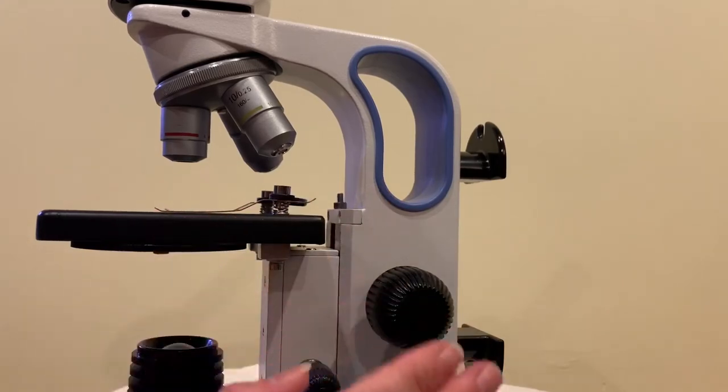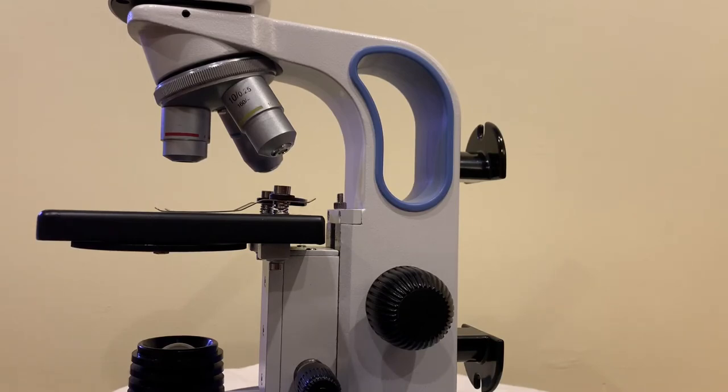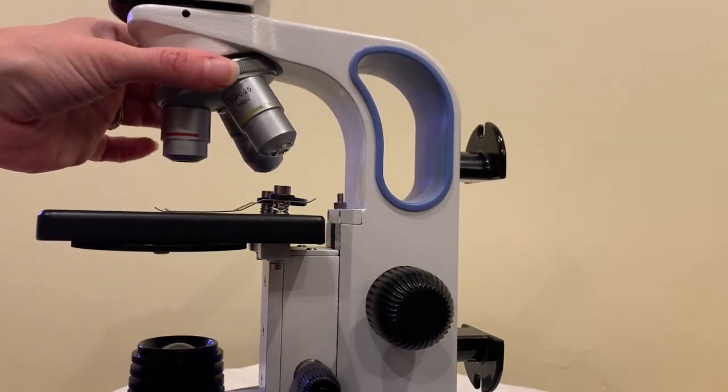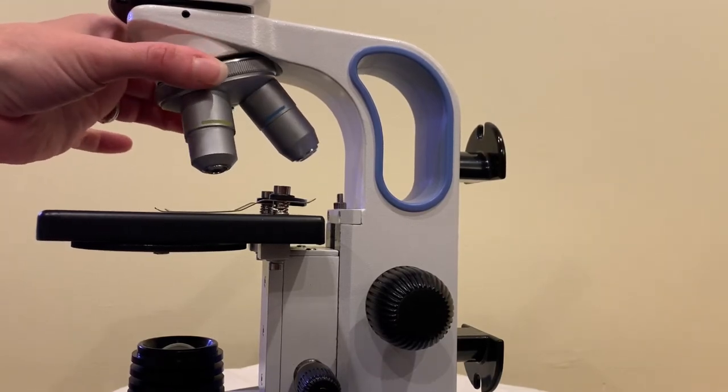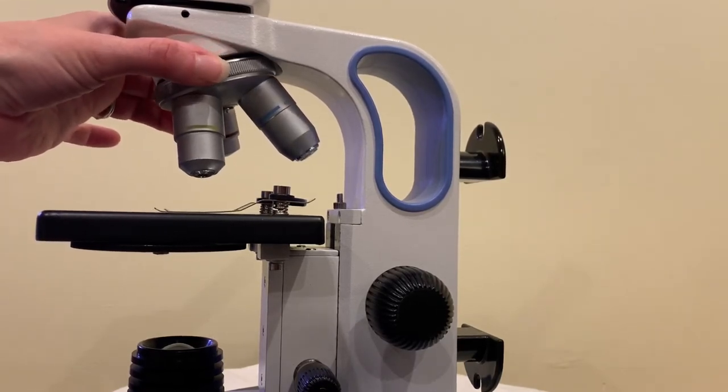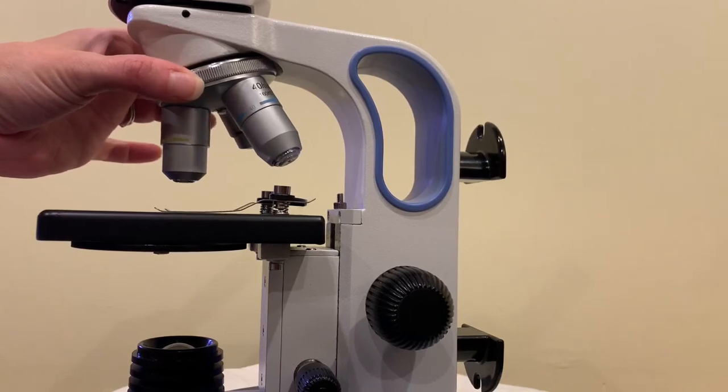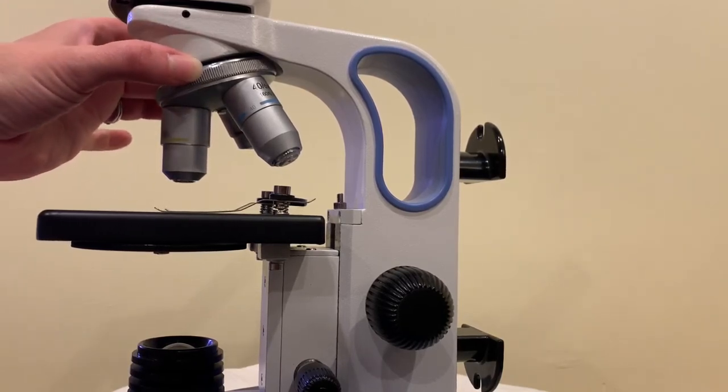Now once that's in focus we want to zoom in. So what would we do? Great we would rotate the nose piece to the next highest objective and we'll listen for the click and make sure it's clicked into place.